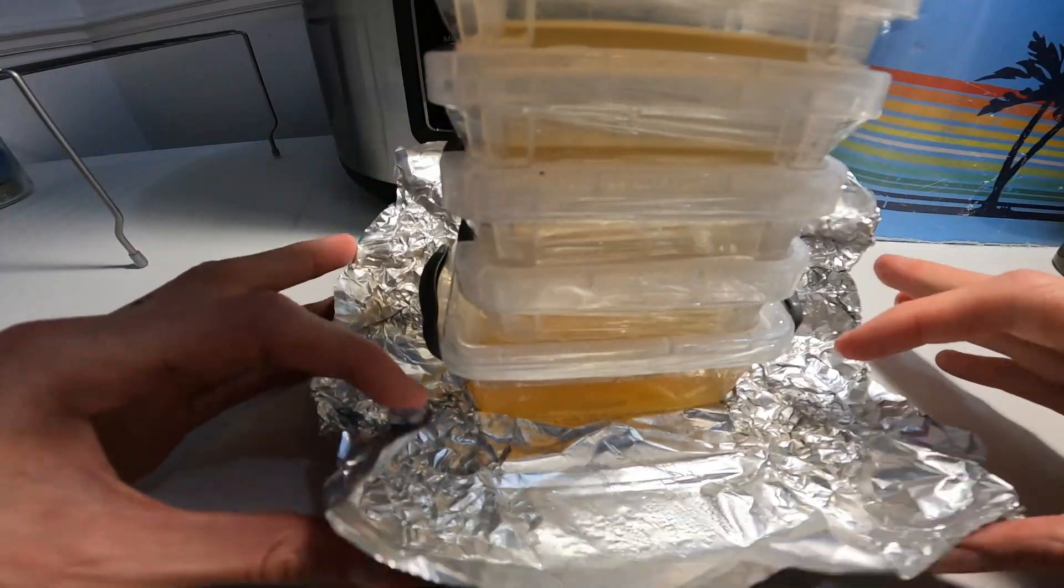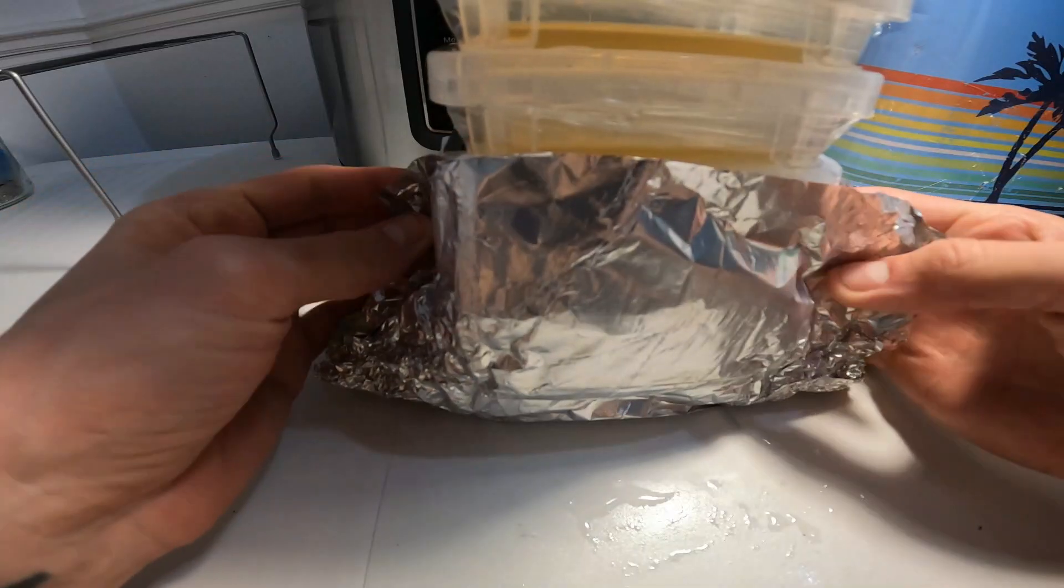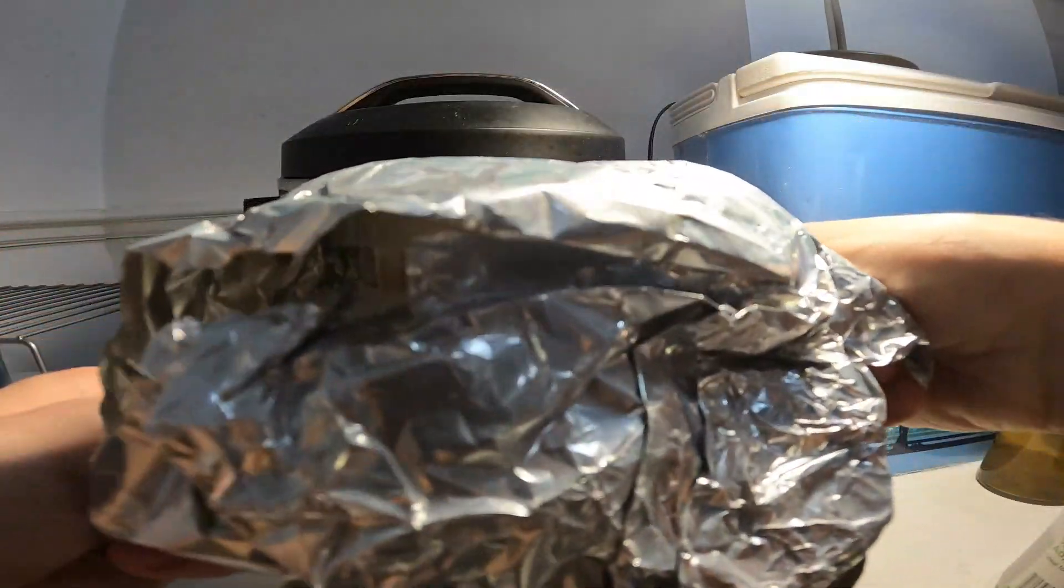Once all the pots are sealed up with grafting tape, I put them back in the box and let them cool down and solidify.